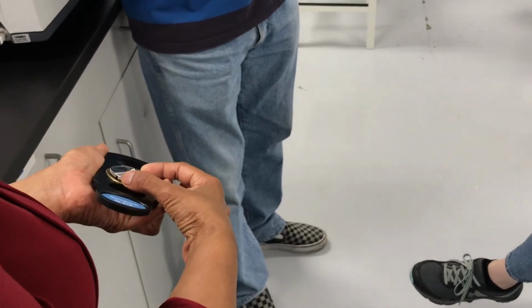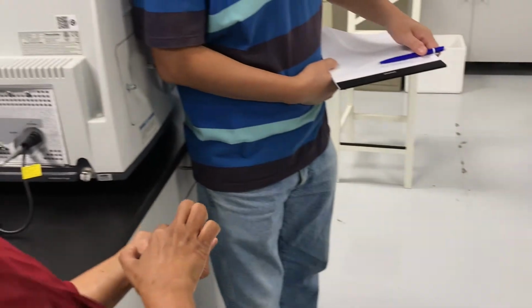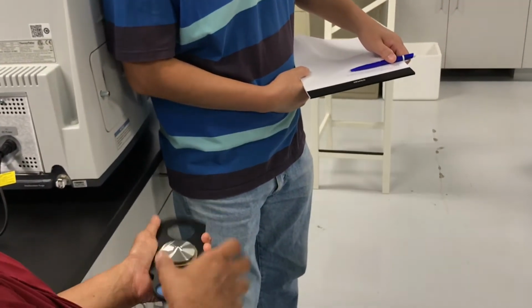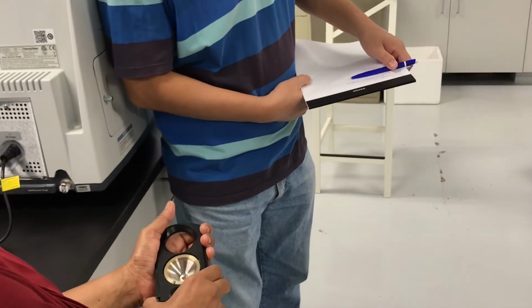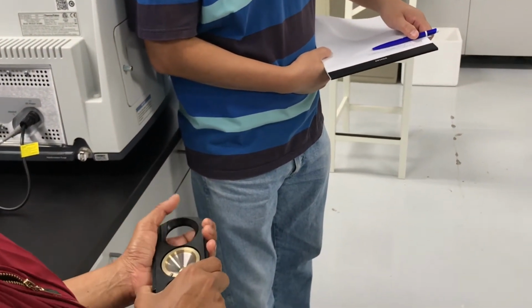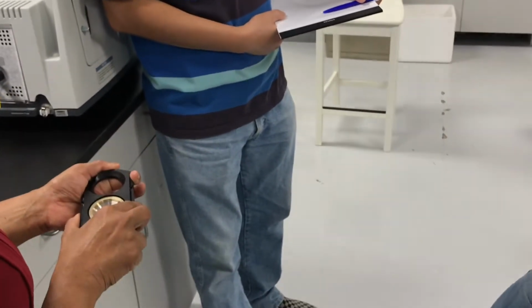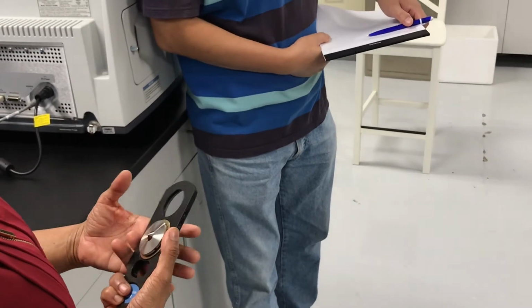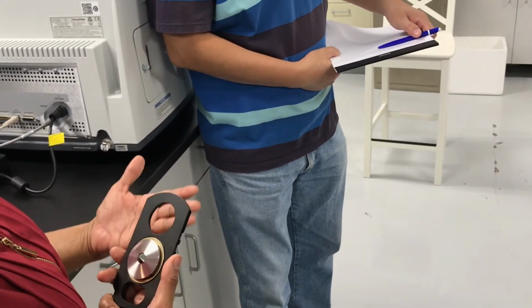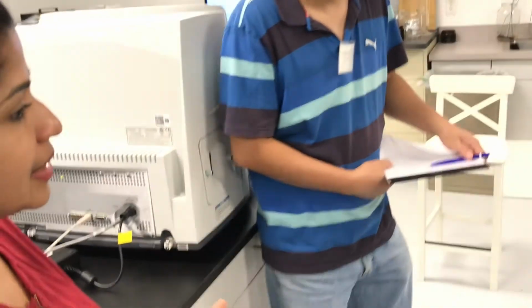This is the only part you need to order, and you get the new one in, you screw it down. There's a protocol, you'll have to align it, just center it and everything like that, so you will have to do the alignment. But it doesn't happen that often, I would say. But yeah, have people broken it? Yes. But most of the times the breaking comes because somebody dropped it. Not with use. It's usually something that has manually happened that it has broken.